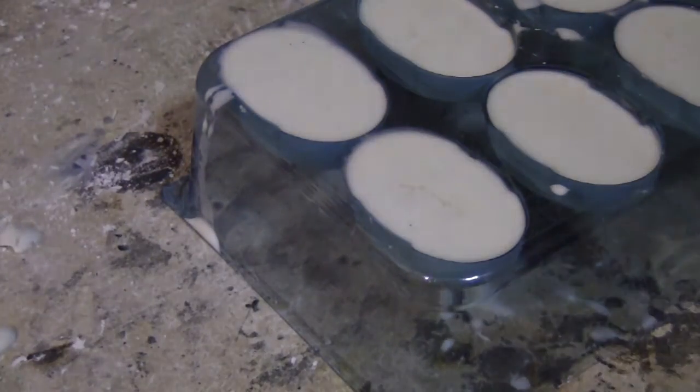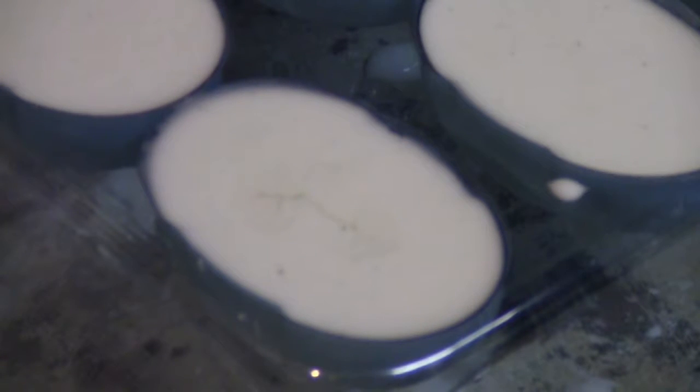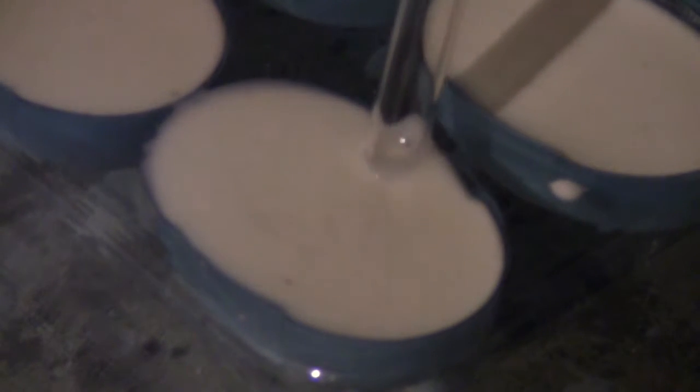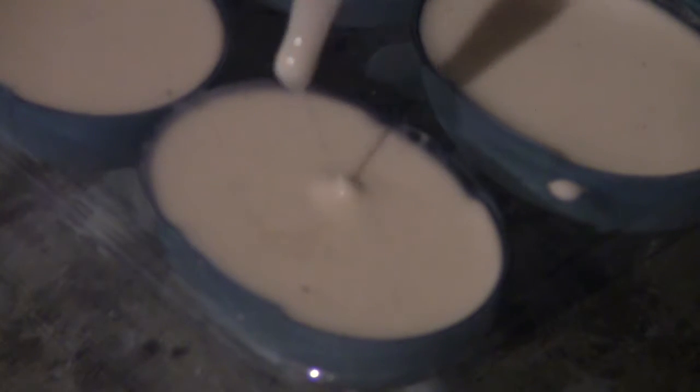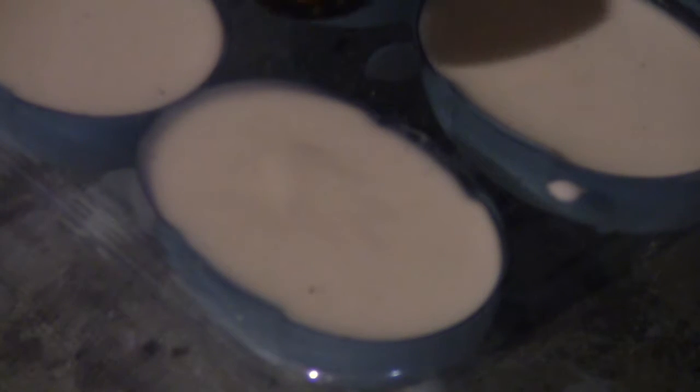Is anything going on? Okay, can it focus as zoomed in? No, it needs to be zoomed out a little. I don't think you can see it. My camera's also out of battery, but there's just a small line here. See what happens as I move this around? Let's just add a bit more. And why not just add all of it?